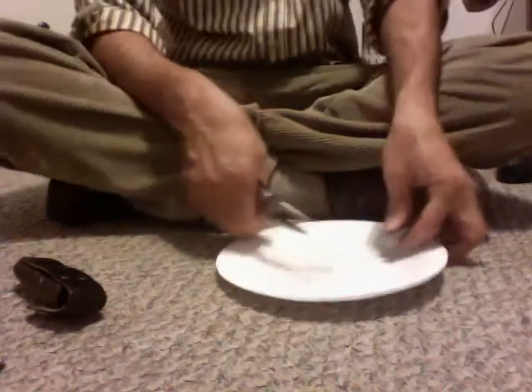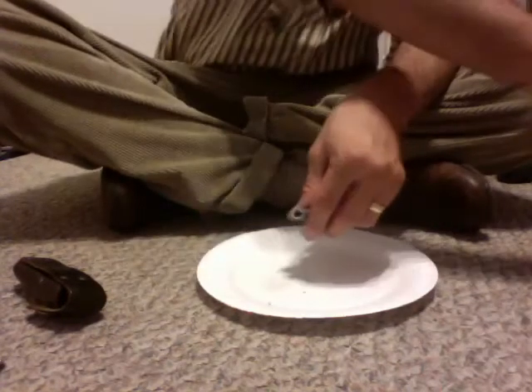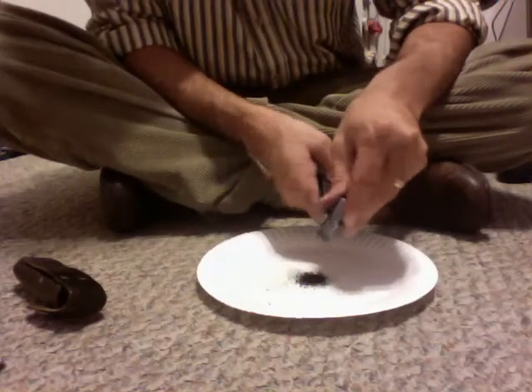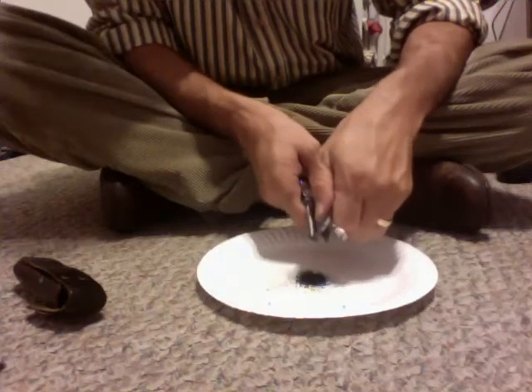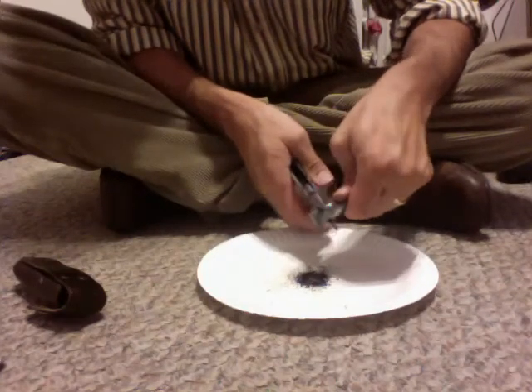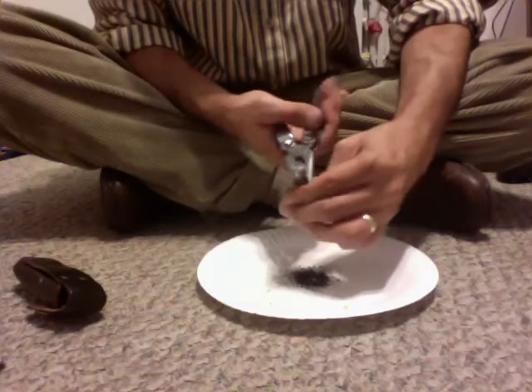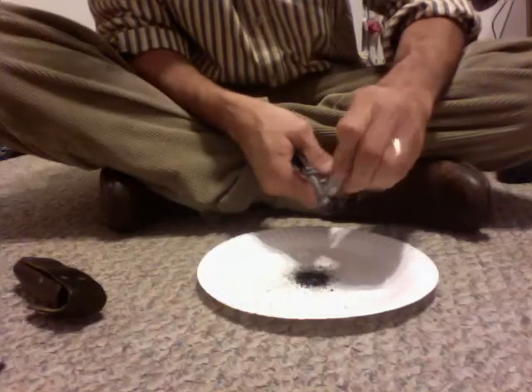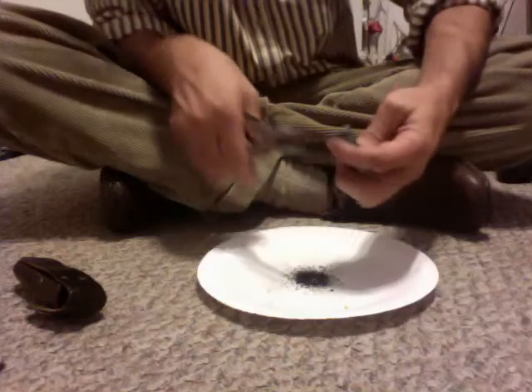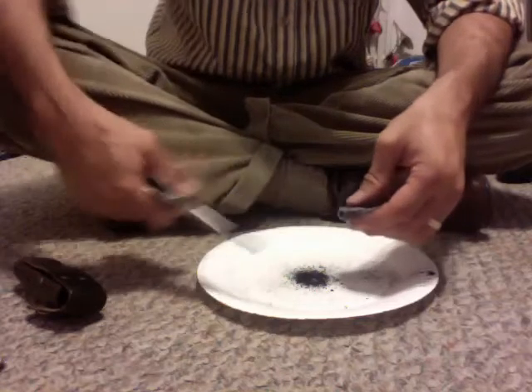I'm just working my way around it, kind of trying to crush the powder. I'm going to pull this cardboard or paper cap out of here and put that aside because I don't want it. As I crunch it, the manganese is going to come out. It's not just straight manganese dioxide, but mostly it's manganese. I'm going to reach back in here and see if I can pull out that carbon rod. Usually by this point — there it goes. And it's kind of cruddy — it's got the black powder all over it.